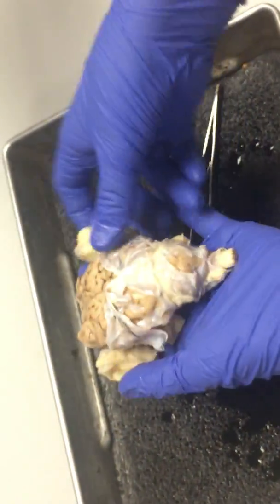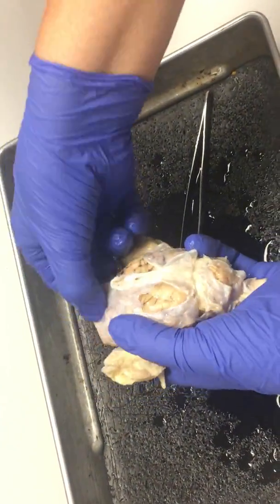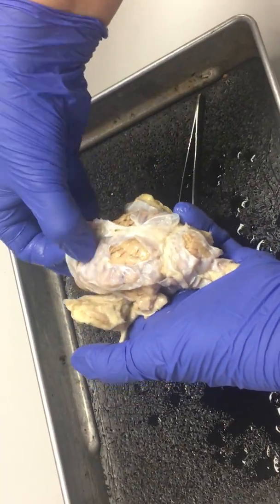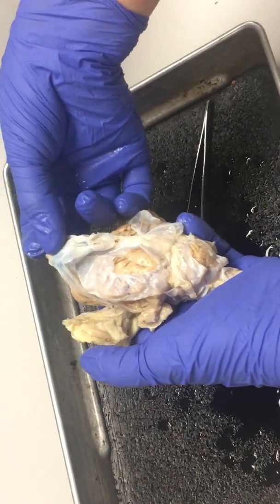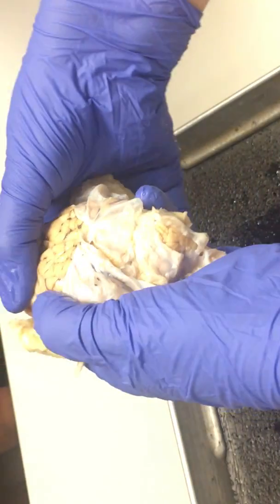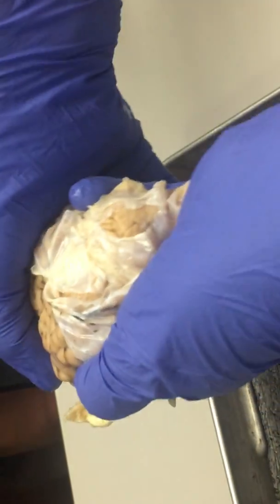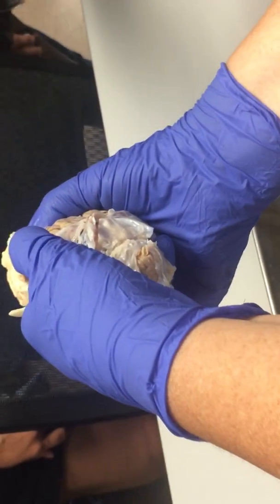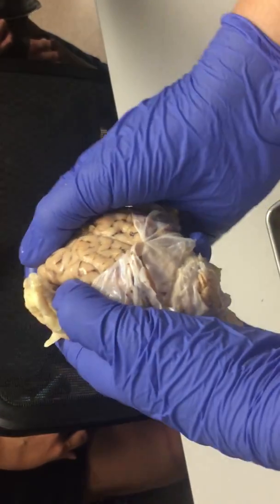The superior part — some of the dura mater broke. So, this is the dura mater. This whole thing is the dura mater with the arachnoid mater as well. But you can see that, if I try to pull apart these little gyri here, it looks like there's a really thin membrane connecting them. That's the pia mater.